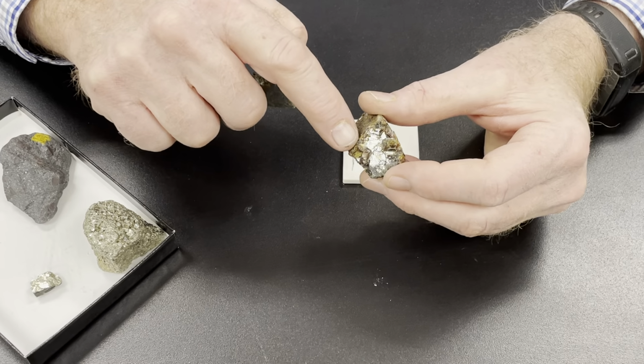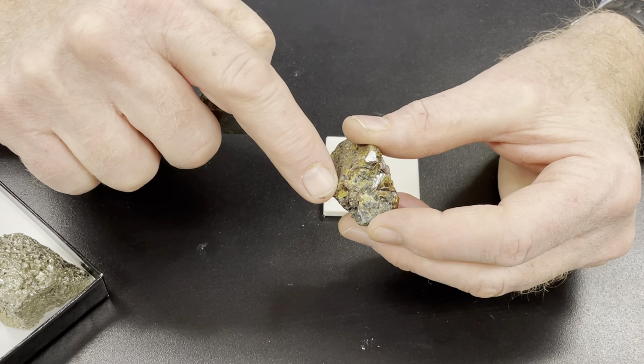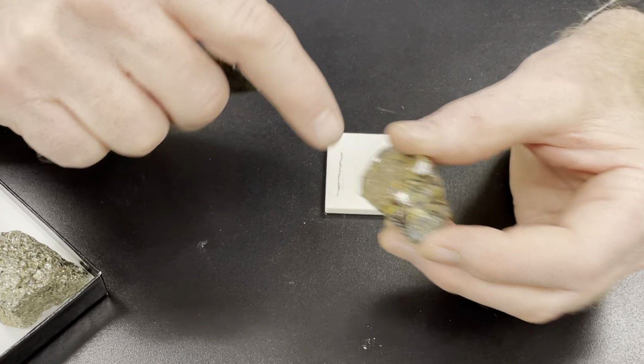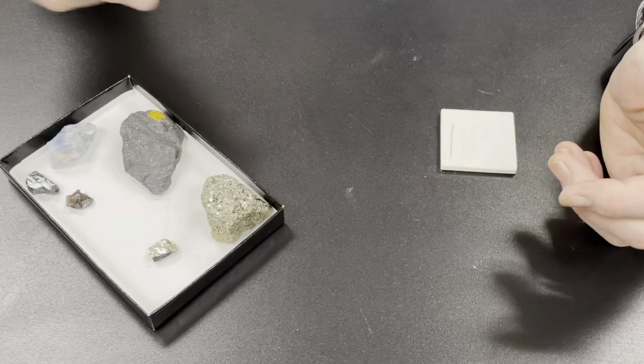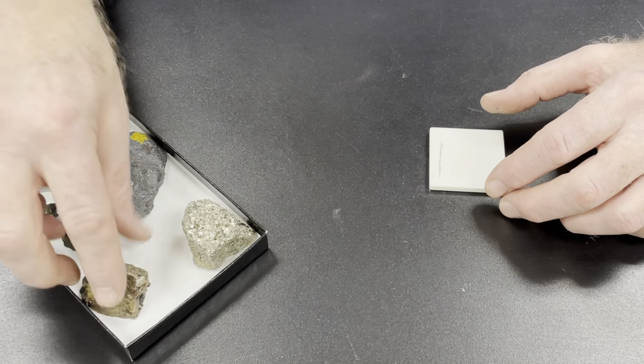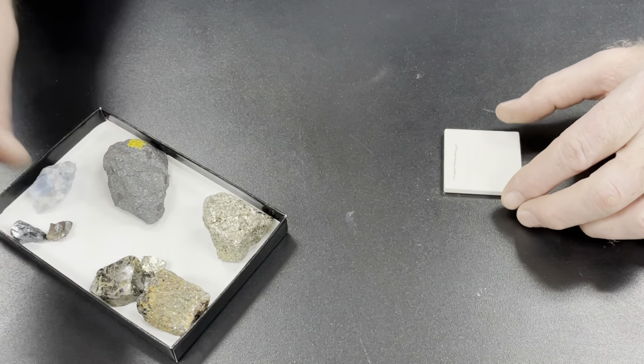And so this has a kind of brown resin-like color to it. When I make this into tiny particles, that brownish resiny color turns into this pale yellow. So these are pretty good. This is pretty diagnostic of sphalerite, that it gives you that yellow streak.